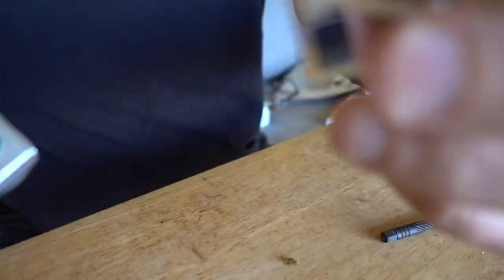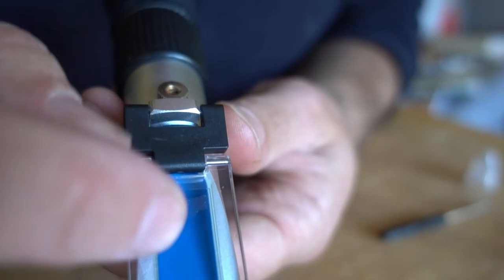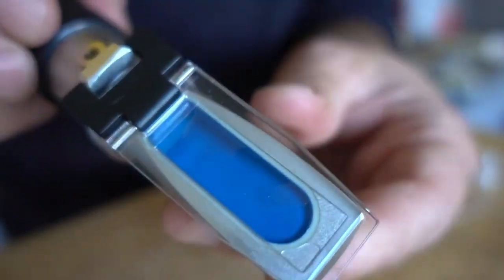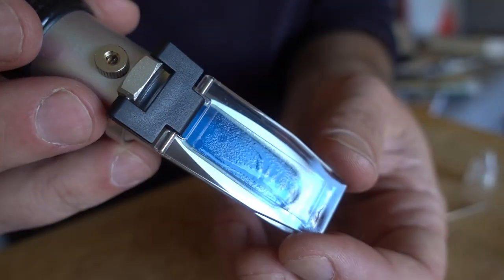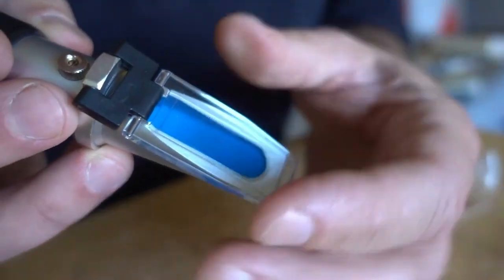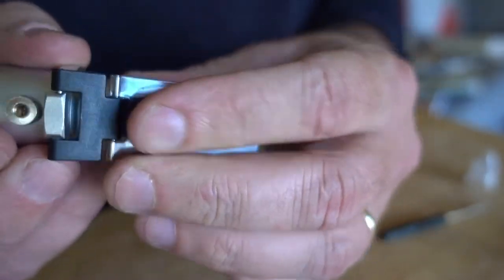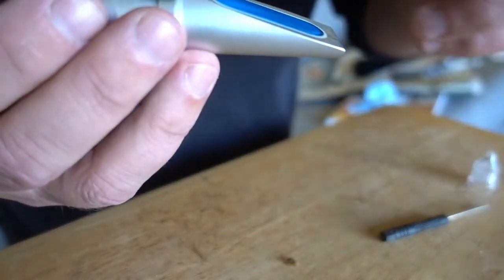And now the reading that I got off this is not 65 but maybe it's because I didn't put enough on. And if you look right here it's hard, it might be hard to pick this up on the camera but you can see you got to squish this thing down and there can't be any bubbles or anything like that, it needs to be perfectly flat.